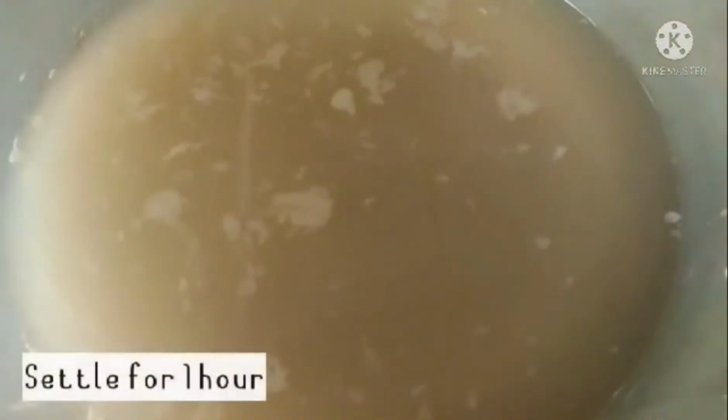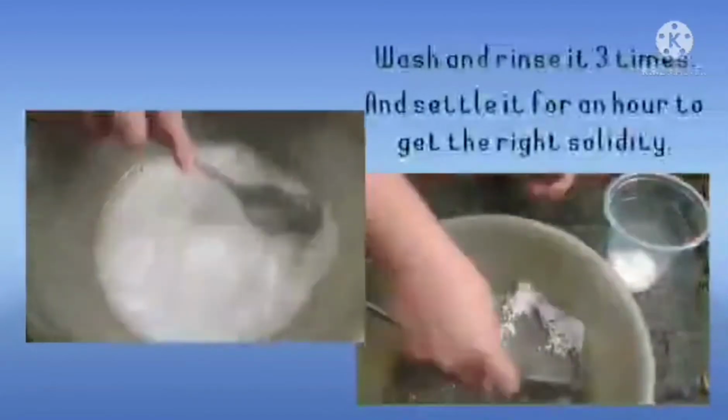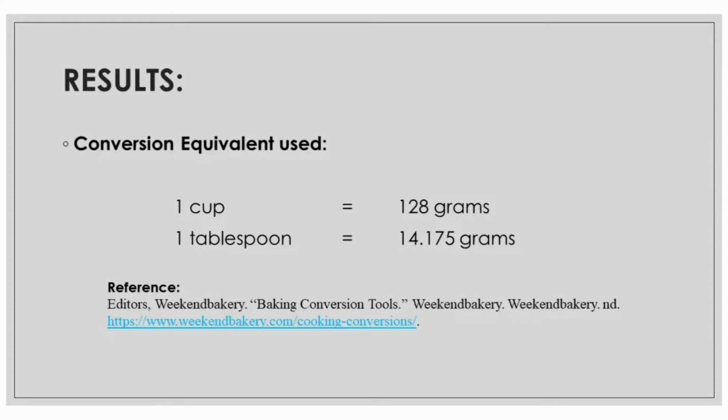Settle for 1 hour. Rinse it 3 times and settle it for an hour to get the right solidity. For the result, these are the conversion equivalents used for the experiment. 1 cup is equal to 128 grams and a tablespoon is equal to 14.175 grams.